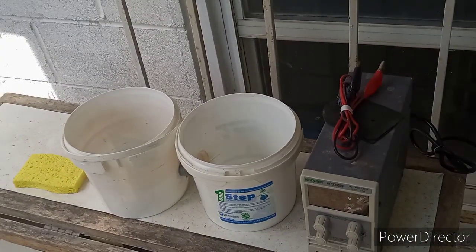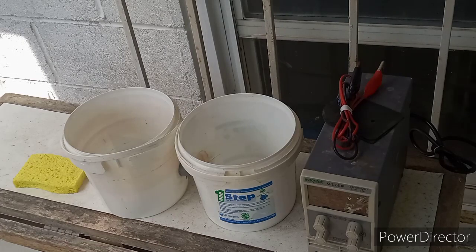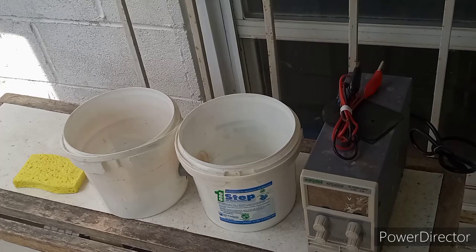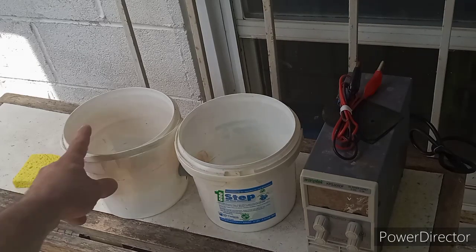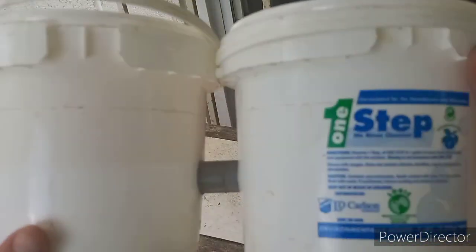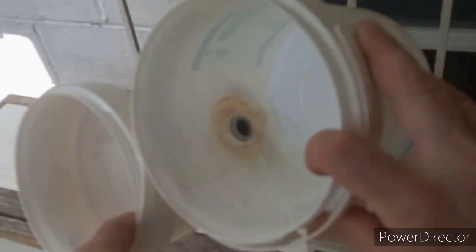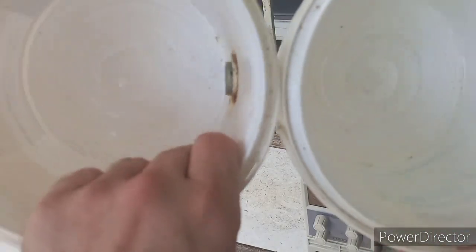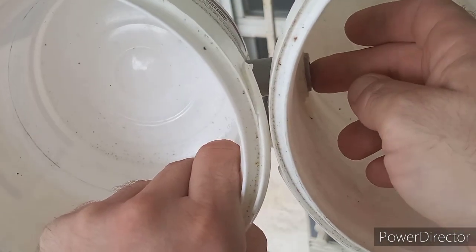First I have to apologize for the noise — I'm doing this outside just to save room in the lab, and my air conditioner is just off camera to the left. I'm going to show you two different ways I make membrane cell electrolysis units. The first one is made from these two high-density polyethylene buckets, two of the same size. What I did was take a step bit and put a hole through here and the same thing on this side, then using PVC cement I secured a one-inch piece of PVC pipe through that hole.